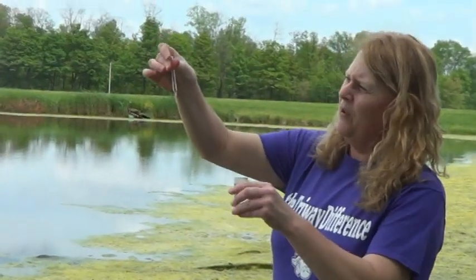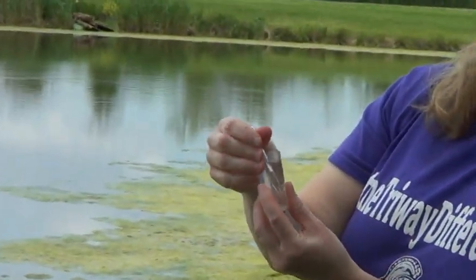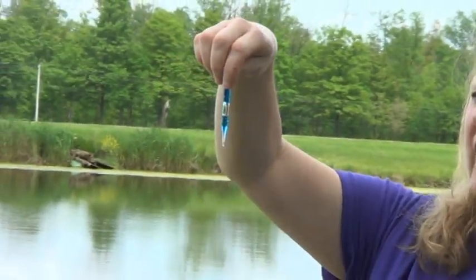So I take the ampoule and there's like a little glass tip on the end. I put it into here and break the end off. And then I turn the ampoule. You can see the little air bubble that turns back and forth. That mixes the chemical with the water.